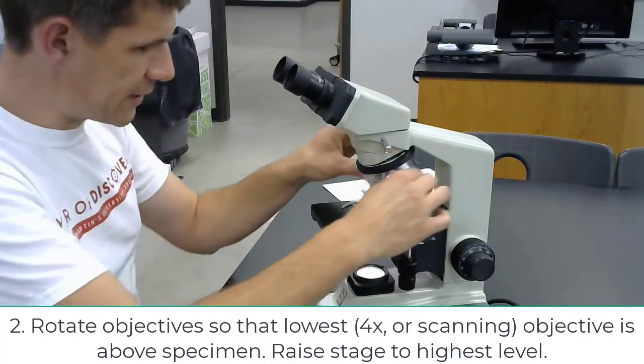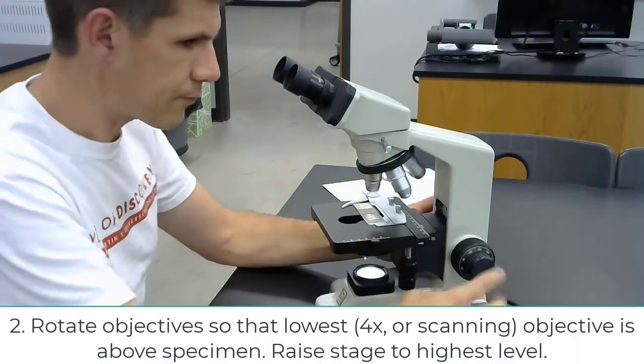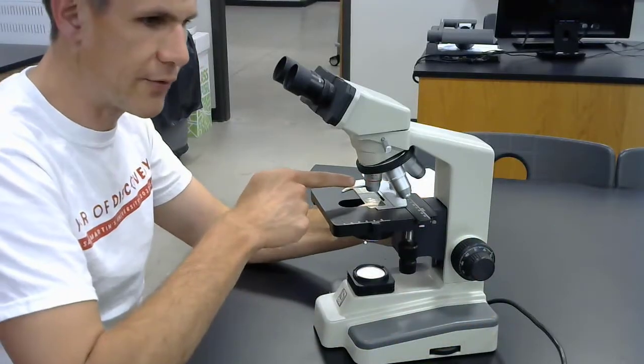Rotate the objective so the lowest objective, the scanning objective, is here front and center. Raise the stage to the highest level—you'll notice it does not bump into the lowest objective.